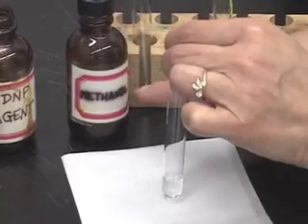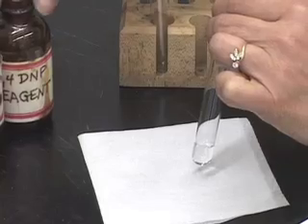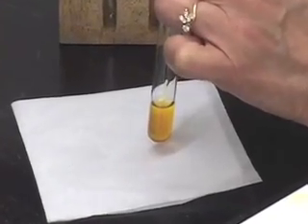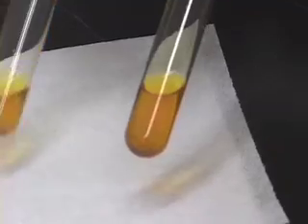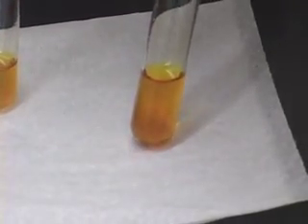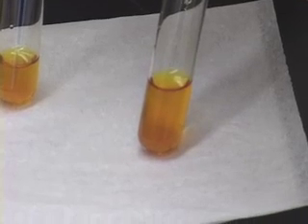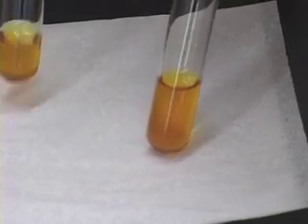I took methanol, which is an alcohol, and now I am adding 1 ml of 2,4-DNP reagent. Mix it well and see what happens. As you can see, there is no change — we did not get a yellow, orange, or red precipitate. This indicates that the compound tested is neither a ketone nor an aldehyde, which is correct because we tested methanol.